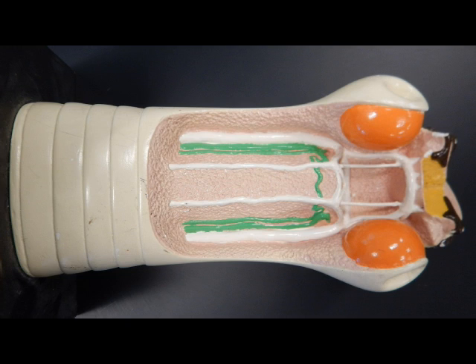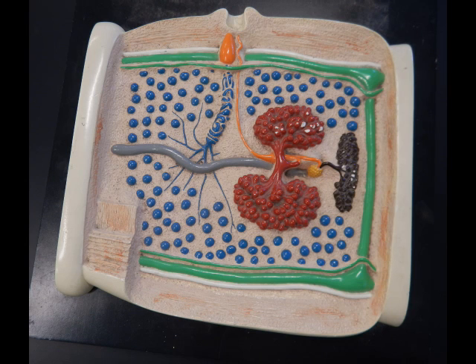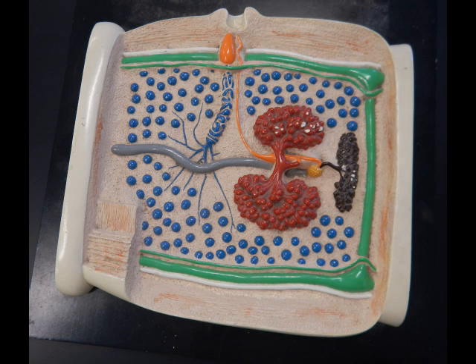Distal to the scolex is a short region known as a neck, after which form a series of proglottids. These are complete hermaphroditic units which form a pair of ovaries and multiple testes. They possess excretory ducts and nerve cords running along their lateral sides.